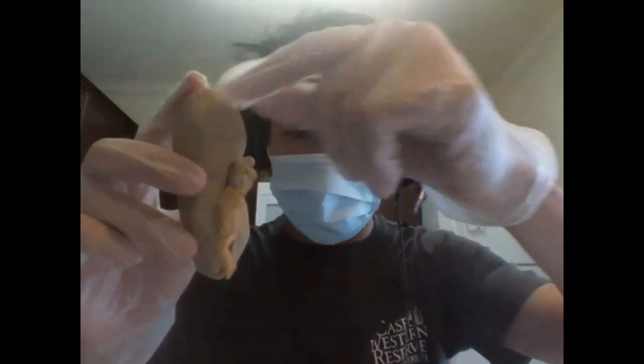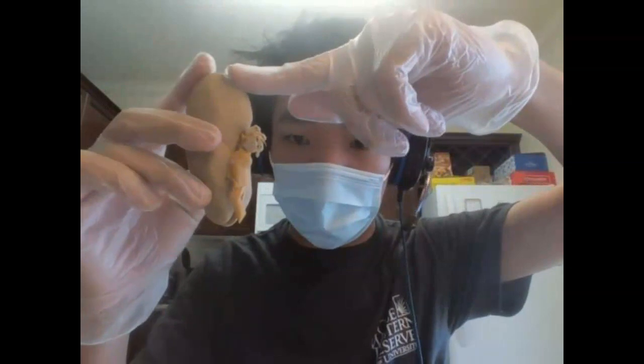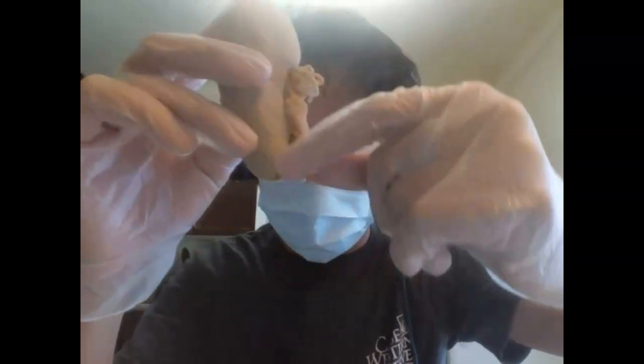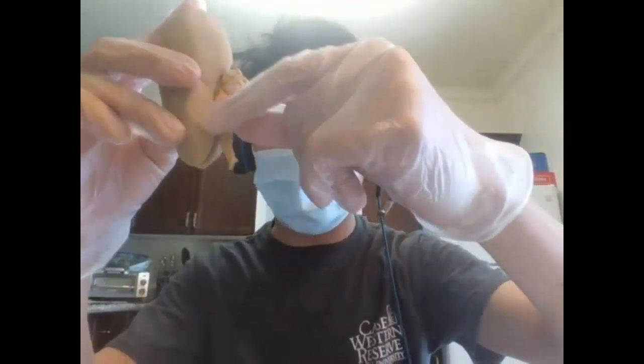So now let's talk about the blood entering the system, right? Blood enters the kidney through this area right here, which is the renal hilum. It enters via an artery. It is then filtered by the nephrons of the kidney, and then it exits via the renal vein. We also have another system right here, and this is the superior portion of the ureter. We know that it's the superior portion because the kidney is superior to the urinary bladder, which is where the ureter connects.